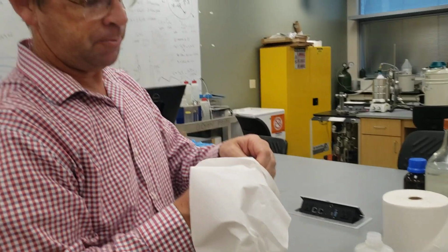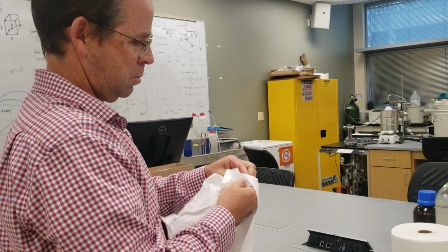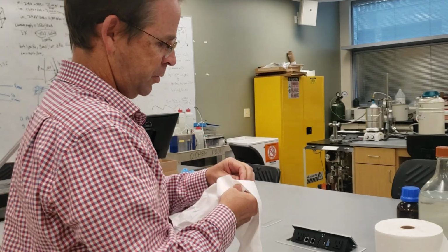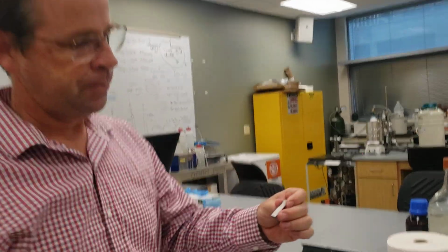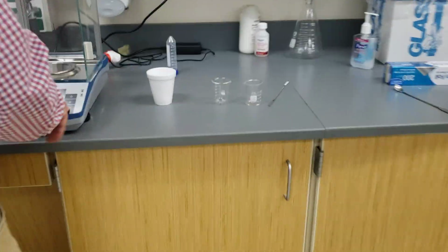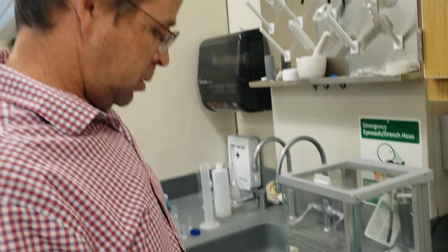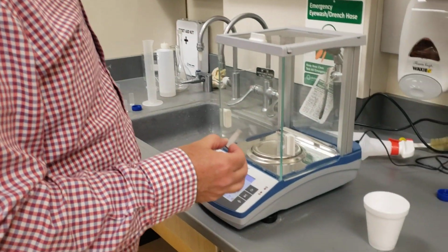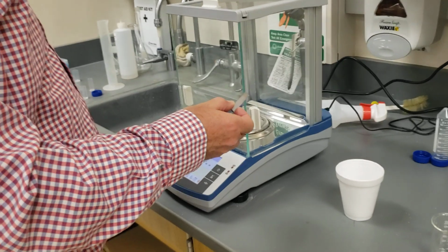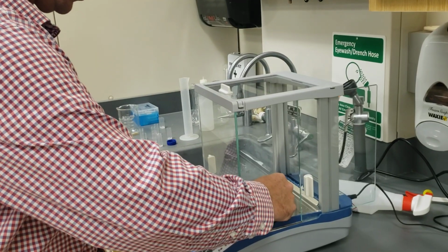So we got some here. All right. Okay, that's good. And then I'm going to go get its mass. Push pause. Right in the middle.